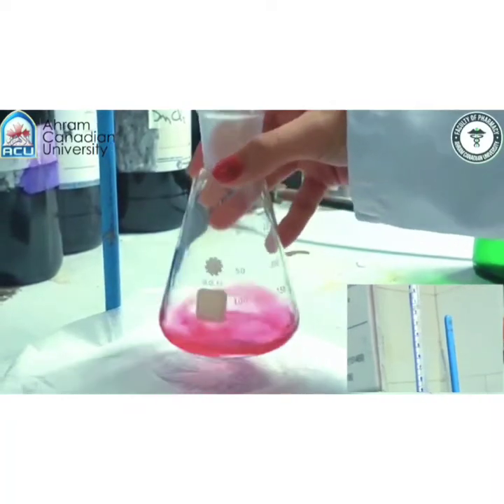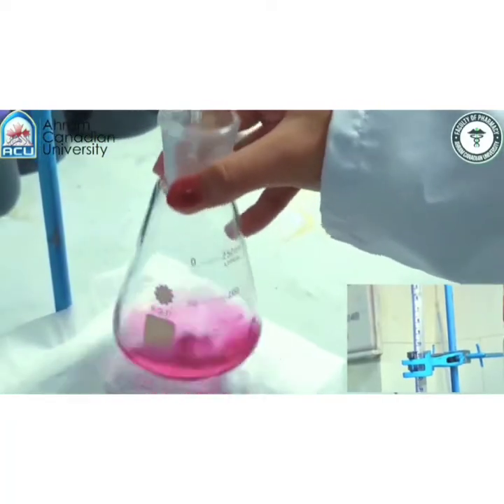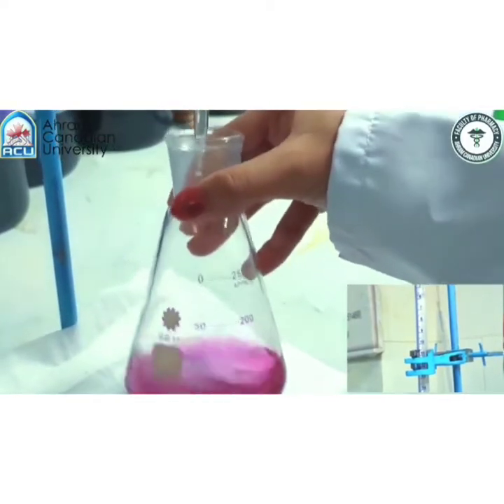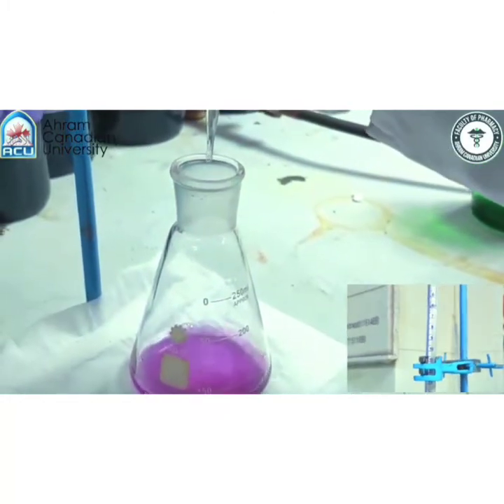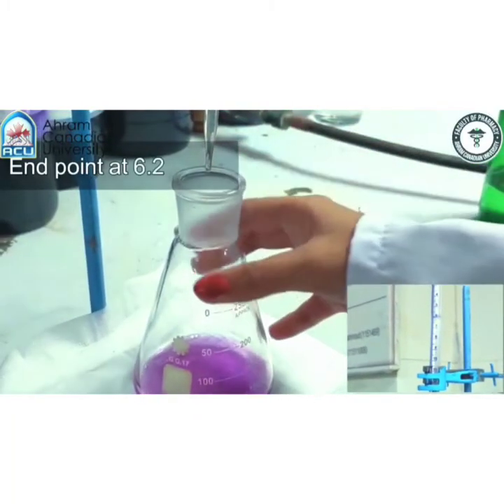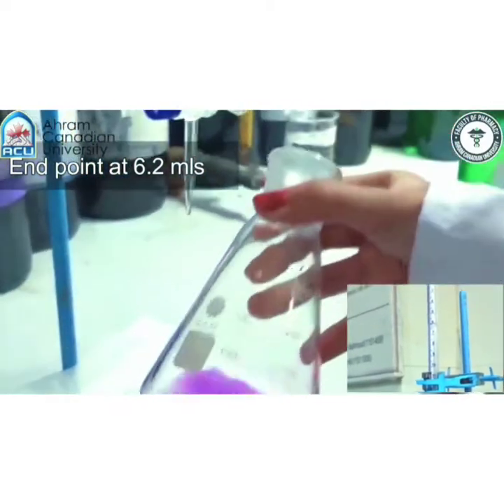Note, you need to take care of the difference between violet and purple color, since during the transition you will see both colors. Our endpoint is at purple, not violet. Endpoint reading at 6.2 ml.